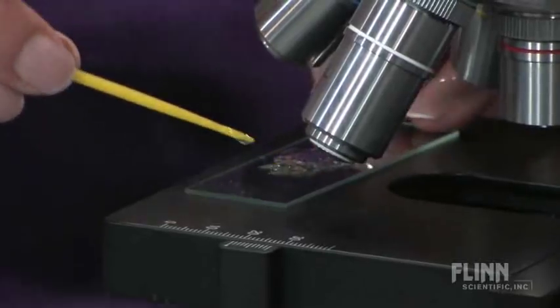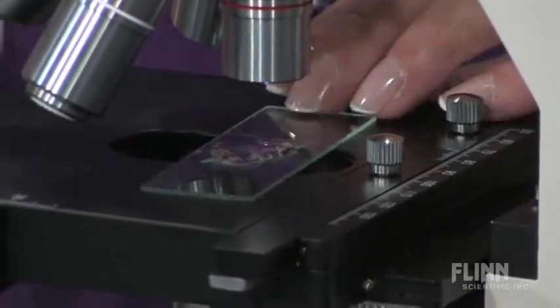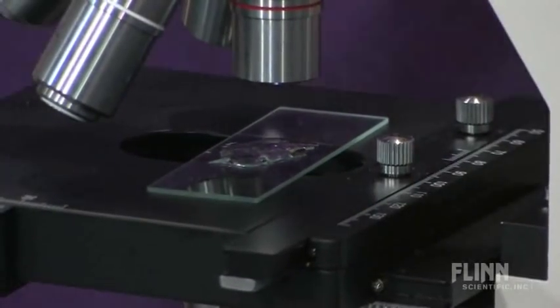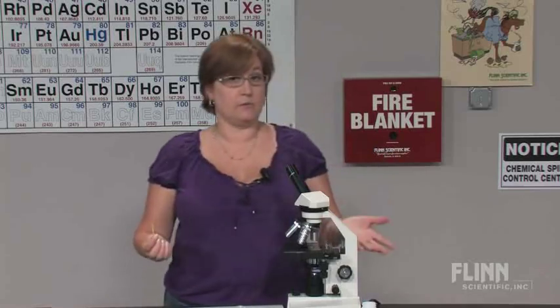It doesn't matter if it's very thick in the center. In fact, that will help you when you're studying the paramecium. Now they're moving very slowly.